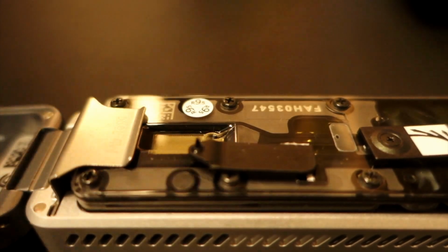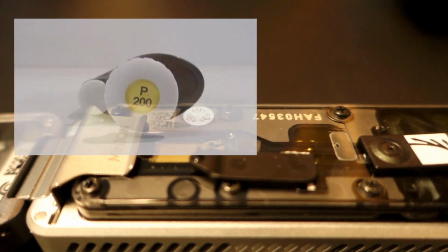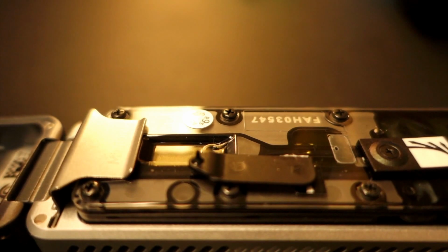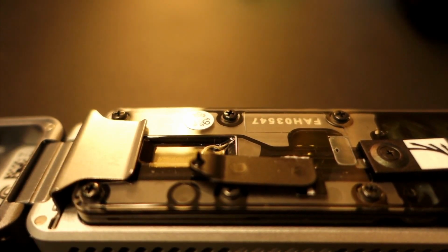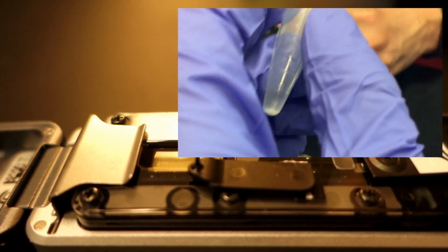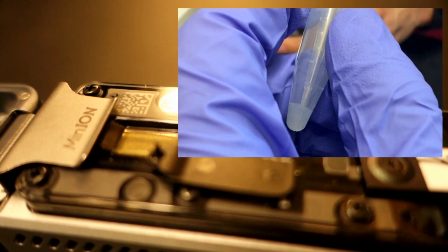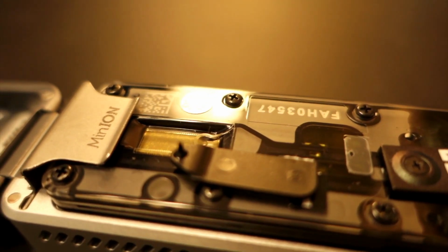The next step, you take your P200 and you'll set it to 75 microliters to load your sample. Make sure you do this very quickly after this step. If you wait too long, the sample will fail to load properly. Now, you must make sure your sample's mixed up. The beads have to be evenly distributed through the solution instead of settled at the bottom.